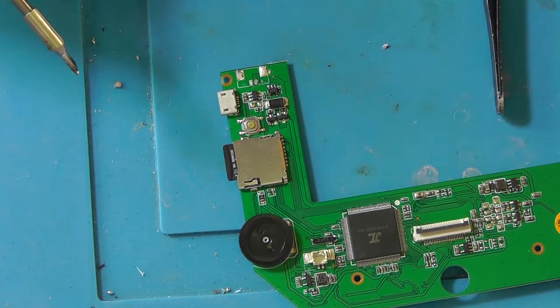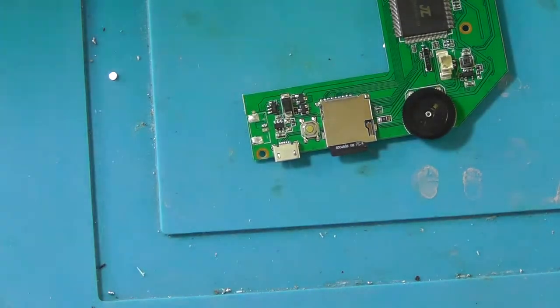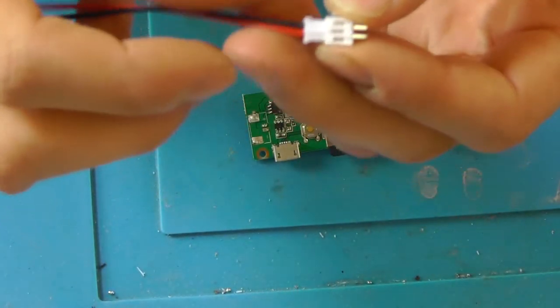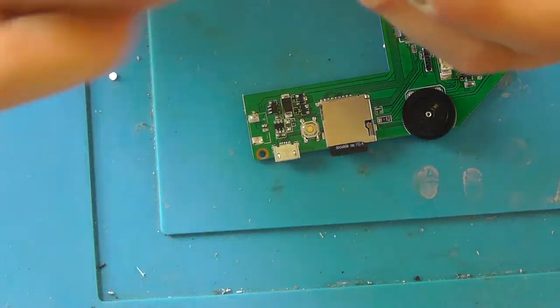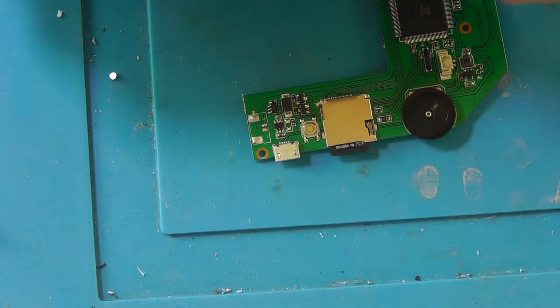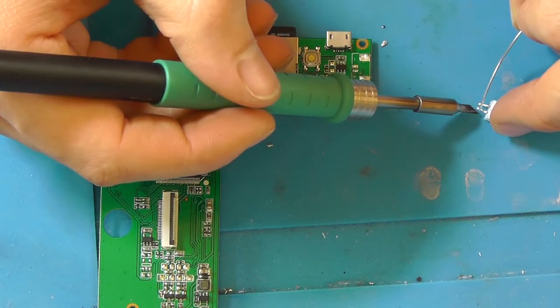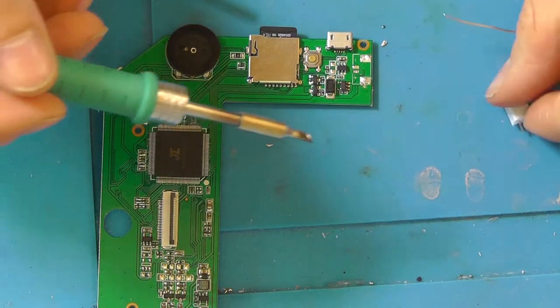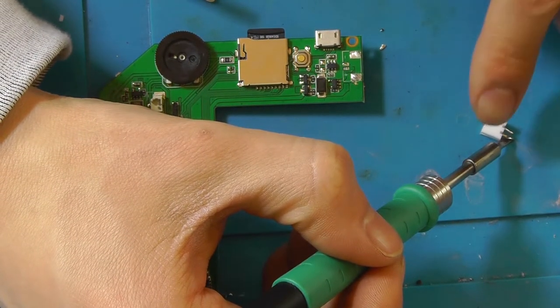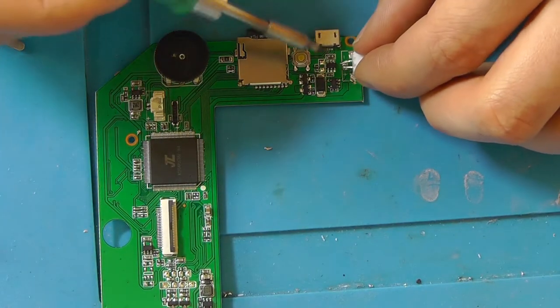Ooh, well, that was not exactly what I was hoping for, but let's try to solder the connector to it. Now the thing goes in like this, and this is the positive side, this one. This is the positive side, but the positive side is over there. So we should solder this connector in like this. And let's add some solder to this thing. Oh, yeah, that's hot. And solder it in place.